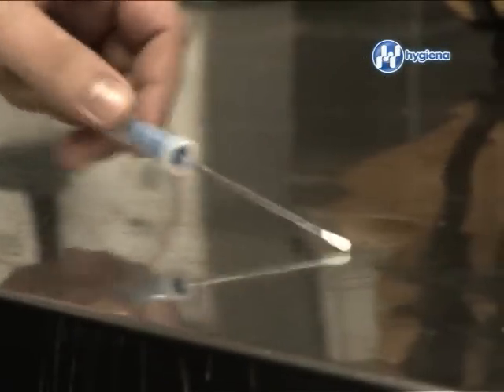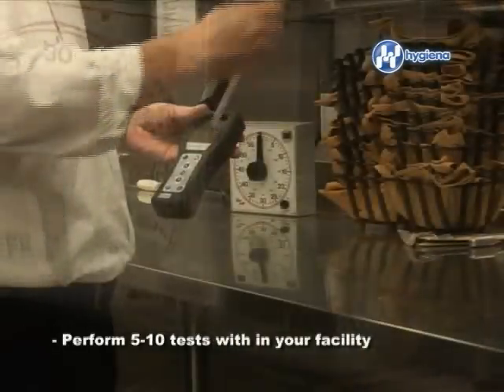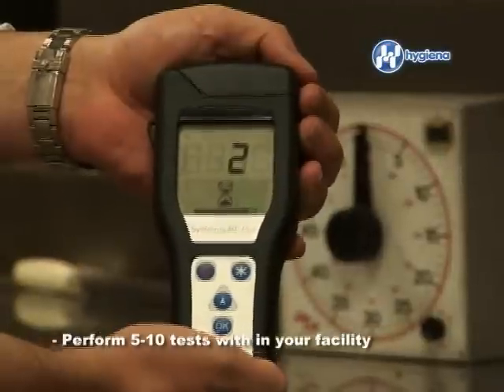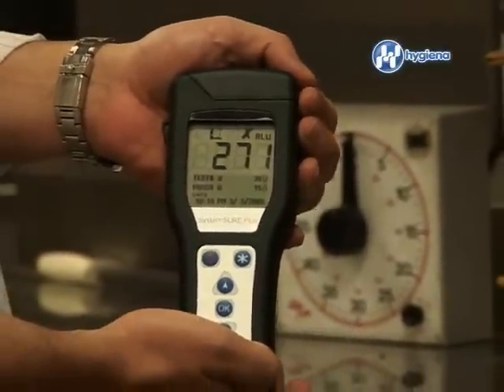environment is. To create a threshold range, perform 5 to 10 sample tests of the same area of the work environment. Repeat these steps in different areas throughout your facility to create multiple threshold ranges, but make sure to do so after each area has been thoroughly cleaned.